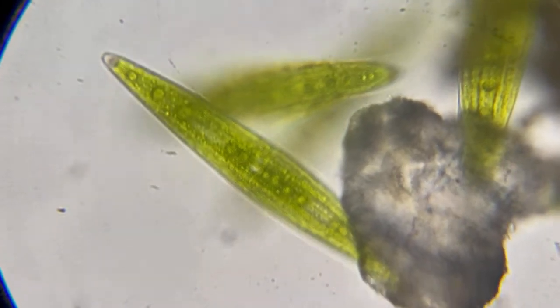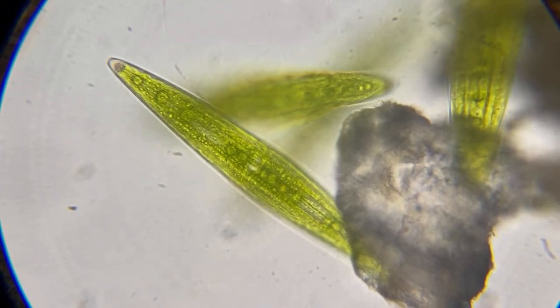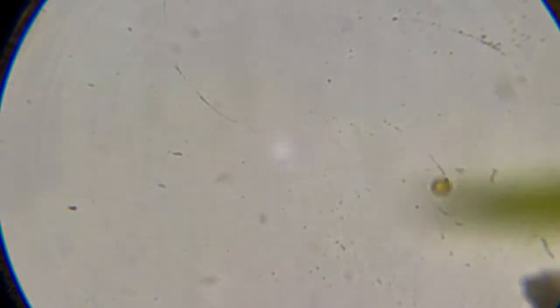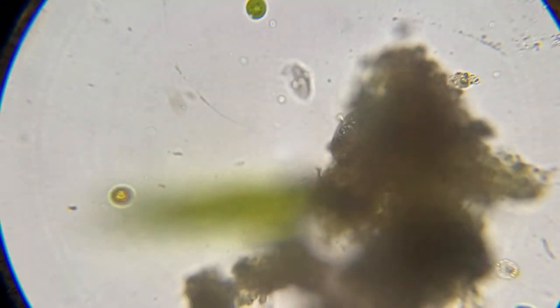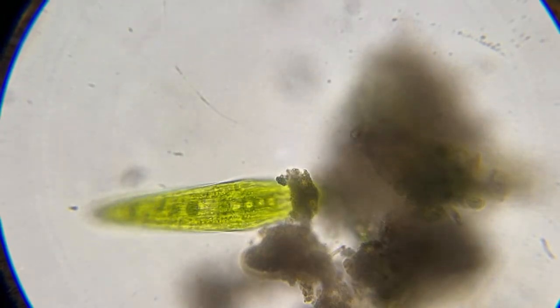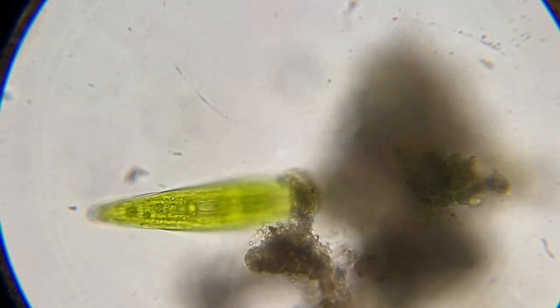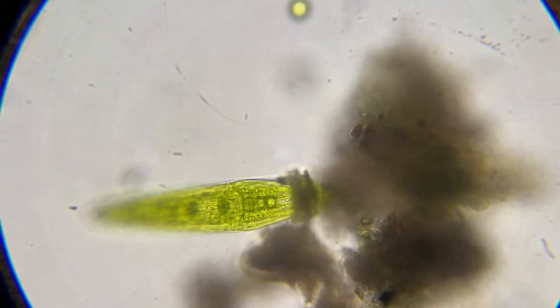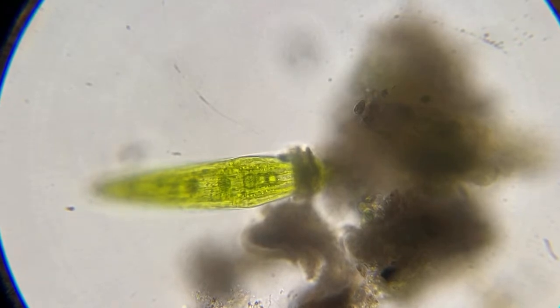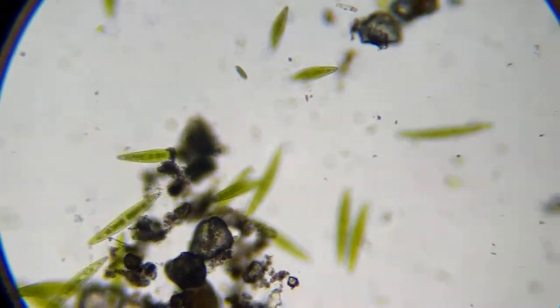So this right here is really zoomed in. Not even digital. So this is 650X with just lens power. And see how out of focus it can get? Because this part right here is a little deeper in the water than this part. So you've got to focus it. And that's why if they're moving around, these things are hard to see. So I'm going to go back out to 100. So now this is 100 and notice how small.